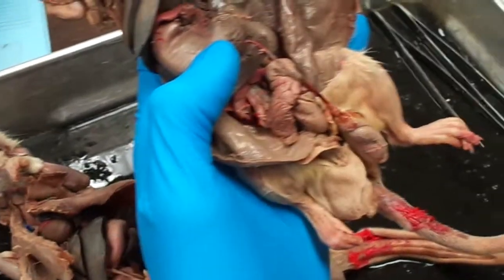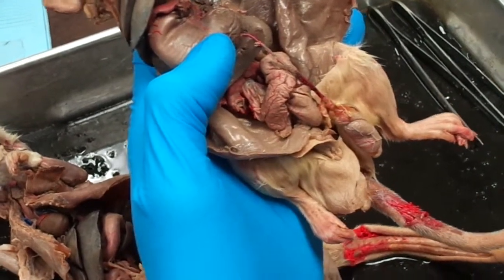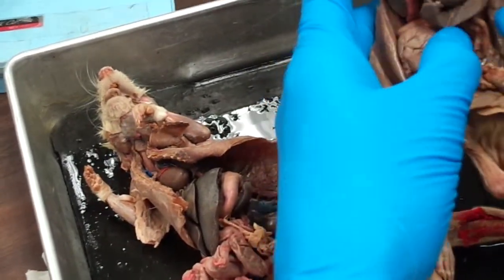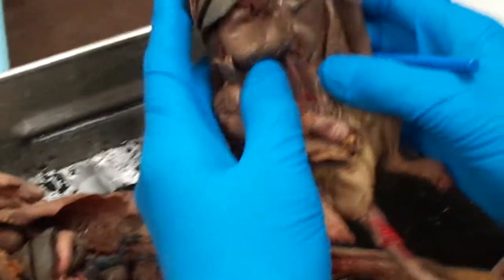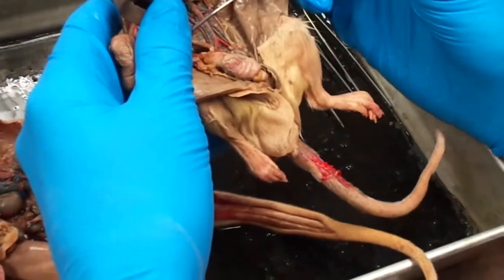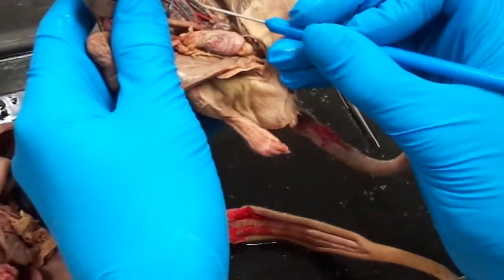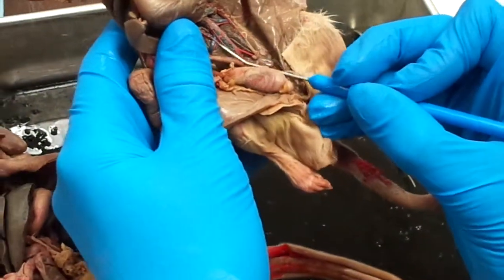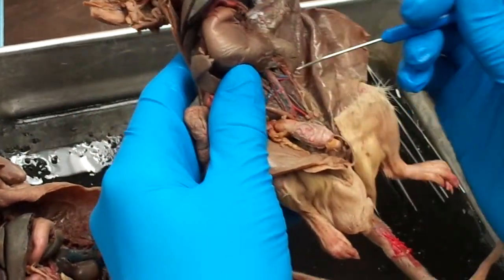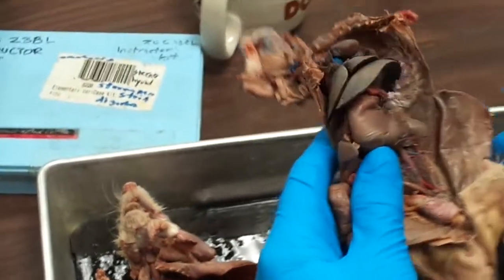So that's your testicular artery. Next, two horizontally running ones are going to be perpendicular to the descending aorta, the circumflex iliacs. You will see that these do not necessarily need to be directly horizontal with each other. The left one in this rat is a little bit higher than the right one, but they're fairly clear because they're running with the dorsal body wall, just in horizontal positions.